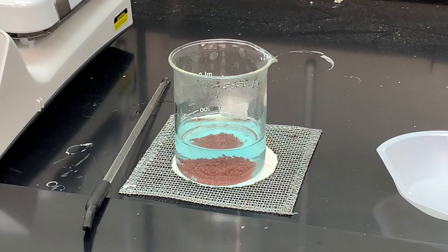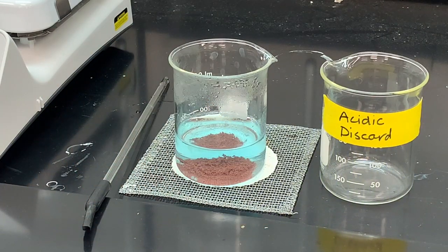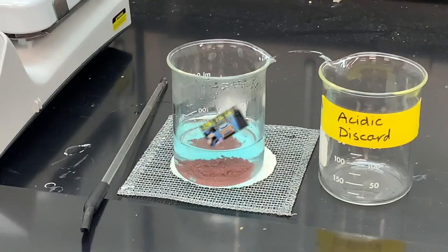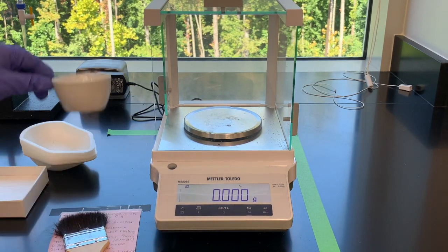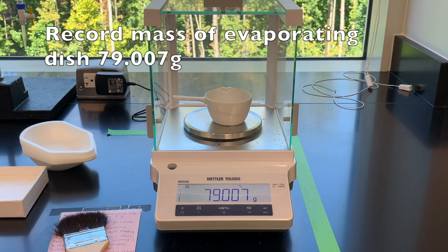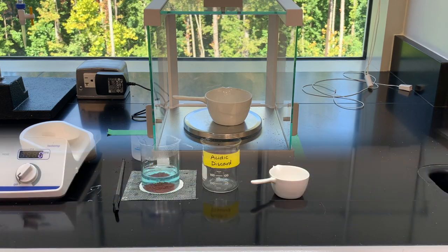I'm going to let that settle. I have a couple of tiny pieces of copper still floating around, so I'll let it settle a minute and then decant it into the acidic waste container. While we wait for this to settle and cool off, we're going to get the mass of an evaporating dish. Always make sure your balance is zeroed out before you add anything to it. This goes into your report sheet — the mass of the empty evaporating dish. The mass of this evaporating dish is 79.007 grams.